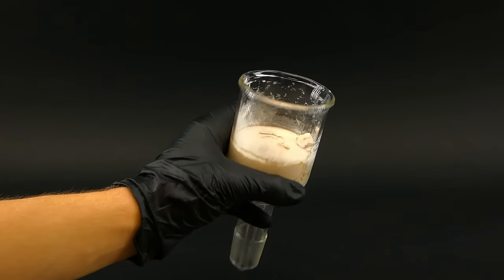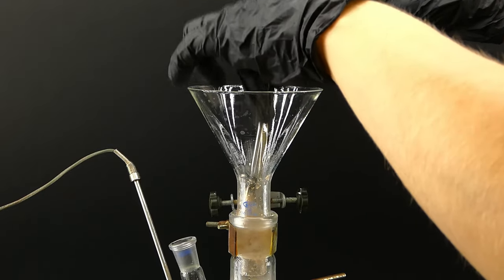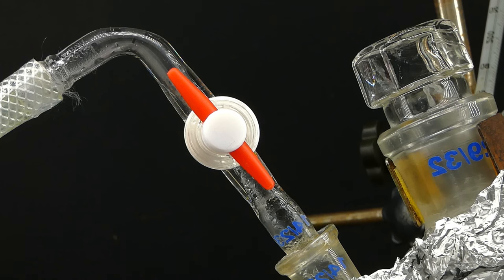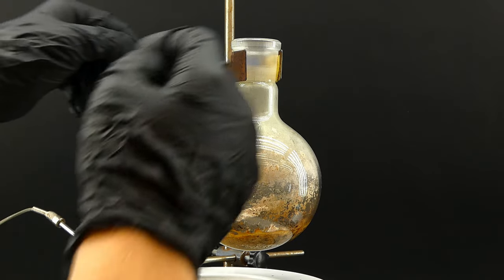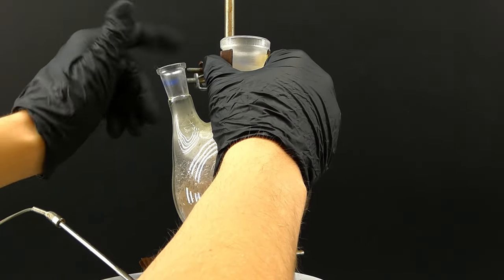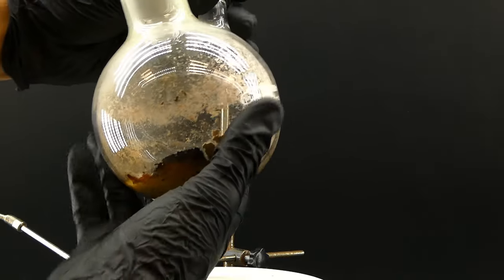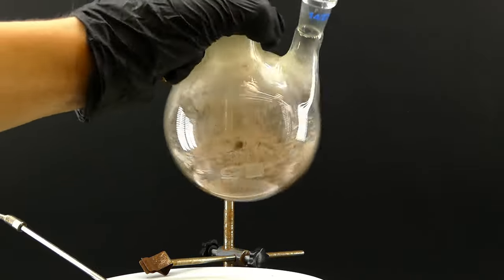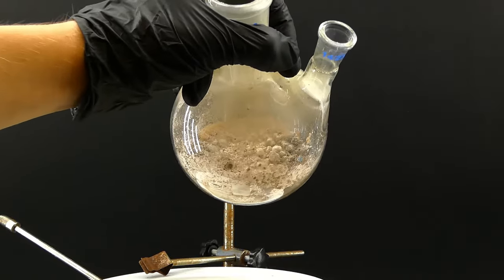When I took it out, it looked much better and had just the right consistency to go into the flask without any issues. I started lightly heating it and pulled the vacuum. The water was coming over just fine at first, but when I came back after leaving it overnight, I was devastated. It turns out my heating mantle somehow went from 60 to 160 degrees Celsius, melting my product into black tar chunks. I was just losing my yield for the dumbest reasons, and this whole thing went from being an easy reaction to a nightmare.